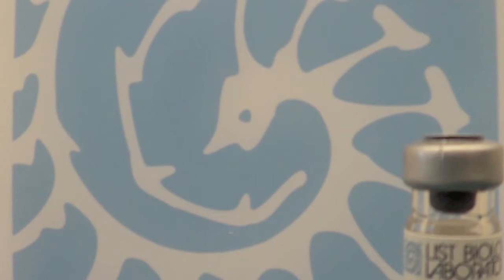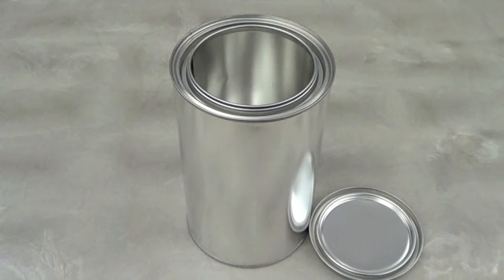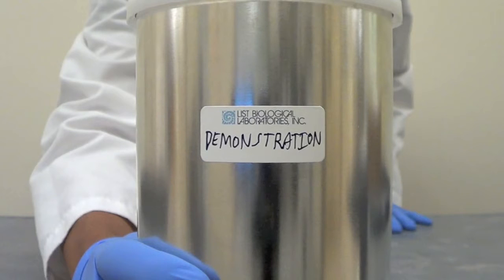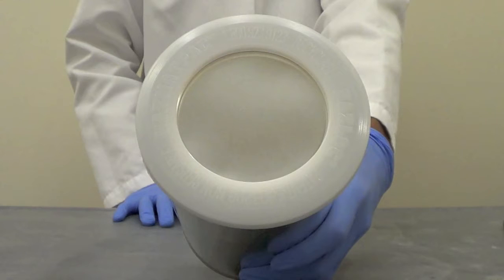List Labs products follow strict containment standards in order to be shipped safely to you. The following are recommended steps in handling these containers. Some List Labs products are considered dangerous goods. These DGs are contained in the United Nations approved Bottle and Can unit from Hazmat Pack.